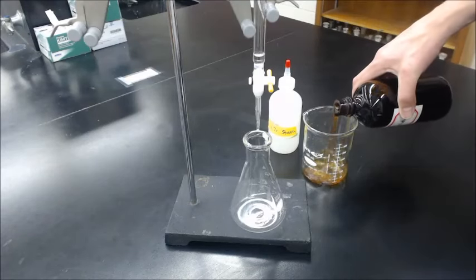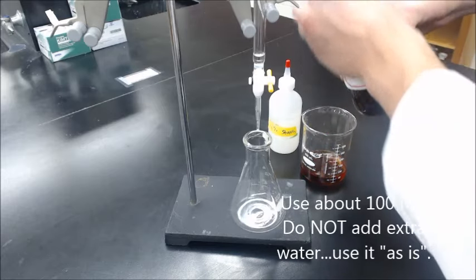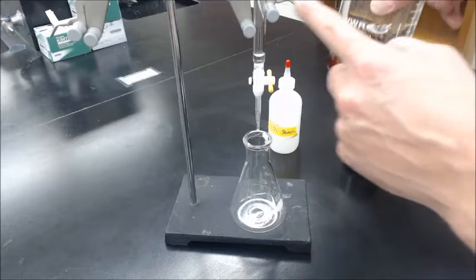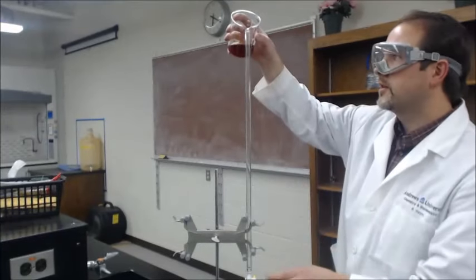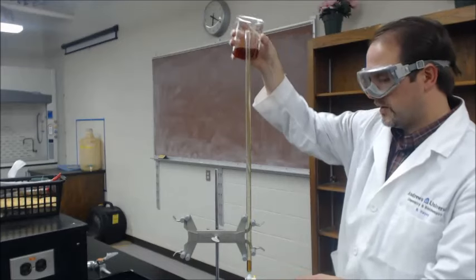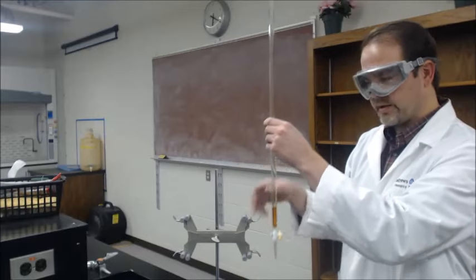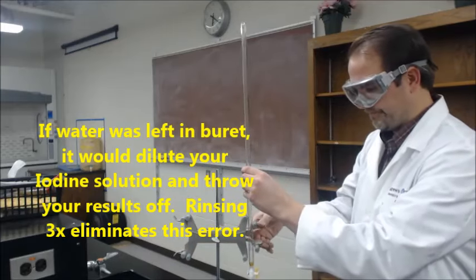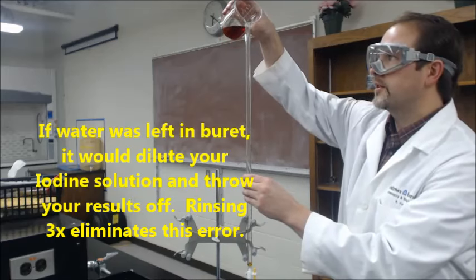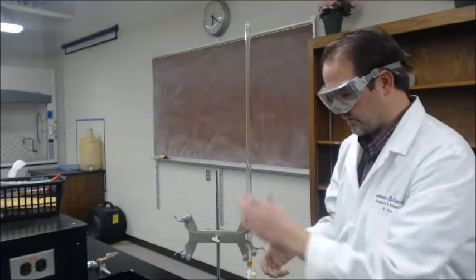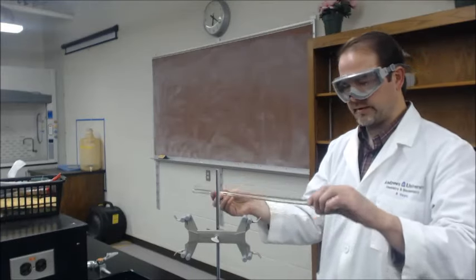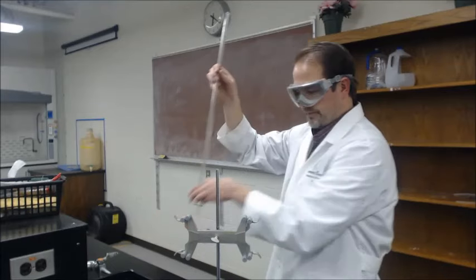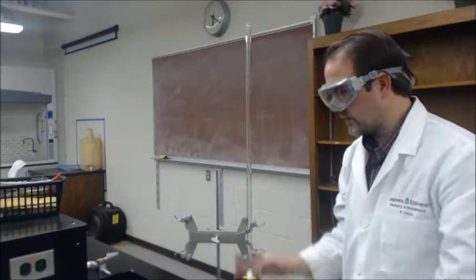50 to 100 mils. Click that in here. And this is what you're going to use in the burettes. You need to get it rinsed first, so you can always take that and discard it into the sink. As the other video showed you, you can roll it around as well. If it's not coming out, you can just shake it a little bit, and that will come out. Close it, and you will be ready to roll out.